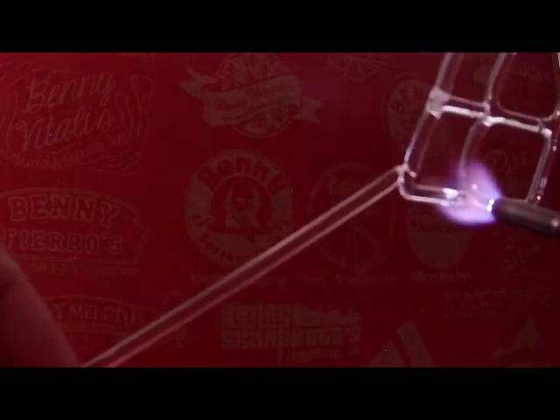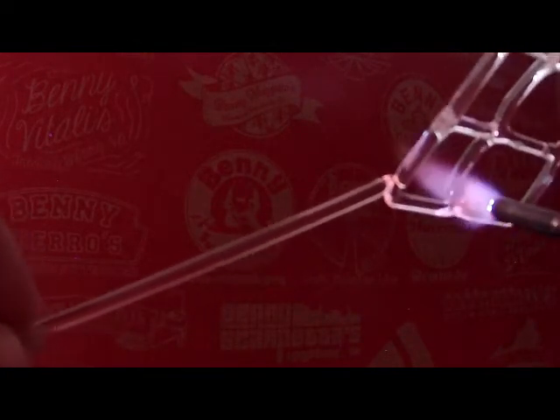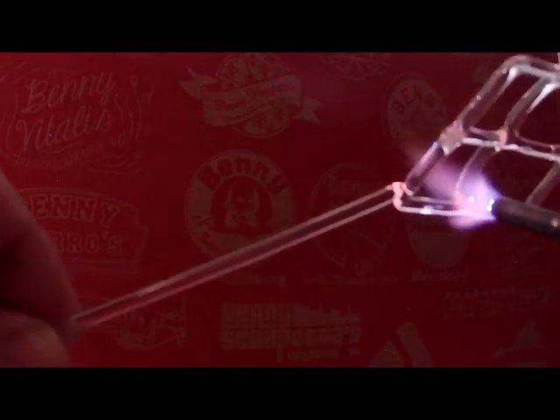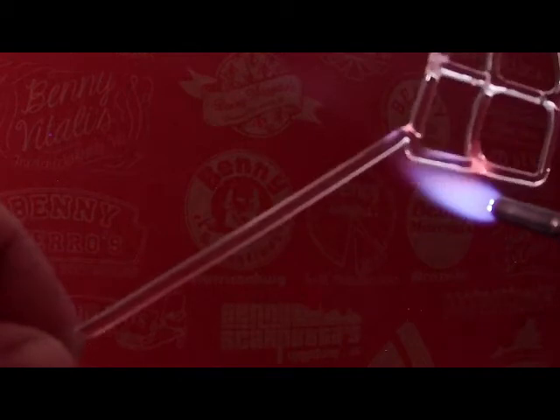So I'm going to come back and clean up the other weld, which probably doesn't really need it, but I'm going to heat it up a little bit more just to bring that a little closer to being more uniform.